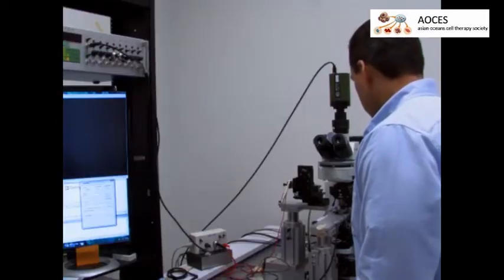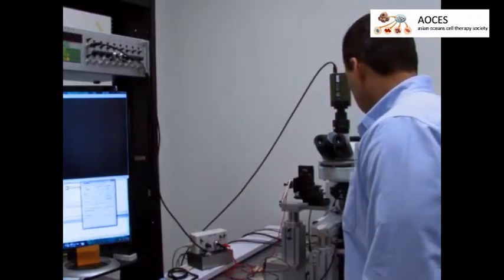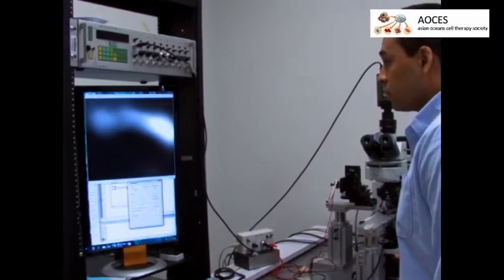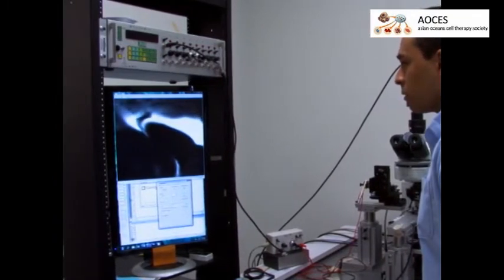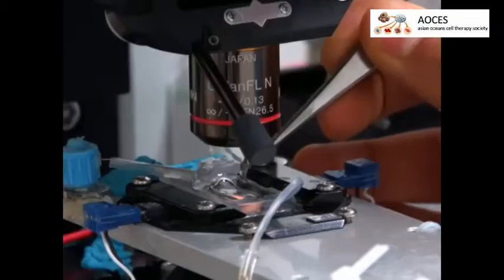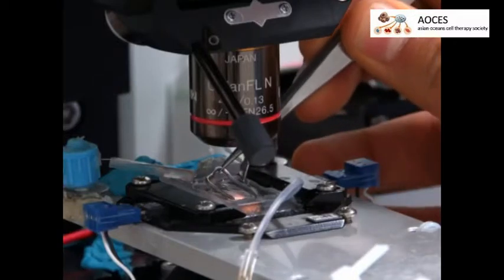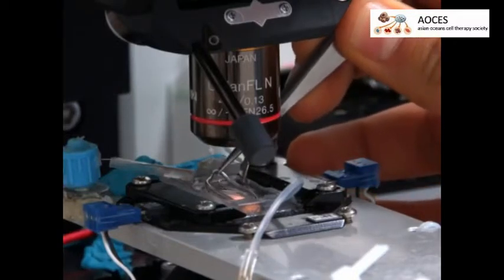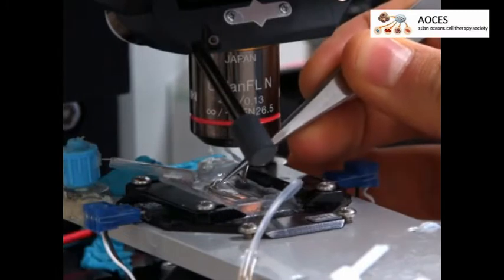Next, using the microscope 4x objective, position the slice so the desired area is placed exactly in the center of the recording chamber. After the desired position has been achieved, secure the brain slice position with a slice hold down, also known as a harp.